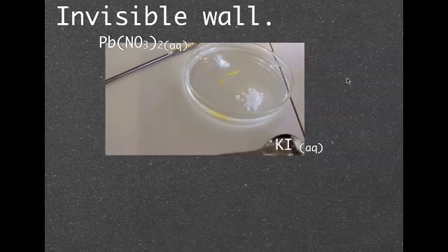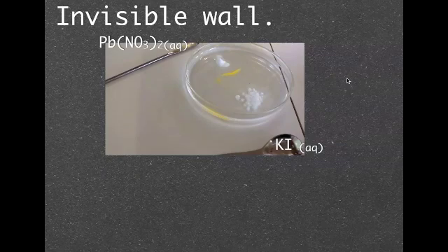You can see it's starting to form there, known as the invisible wall, because it looks like a wall is forming from nothing at all.